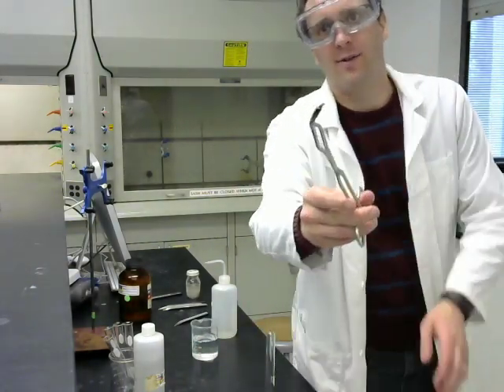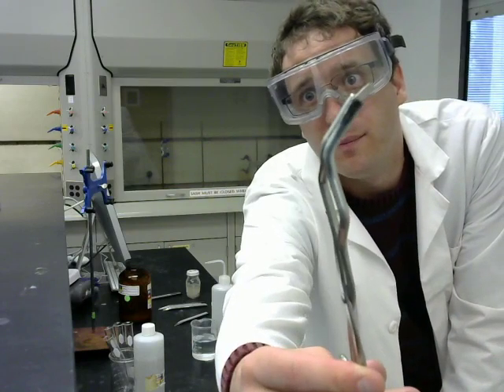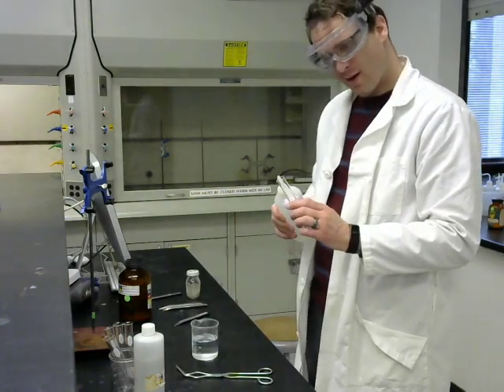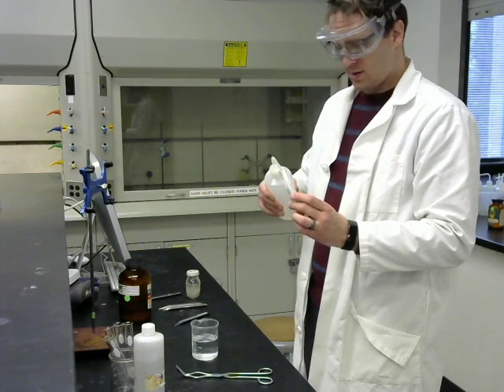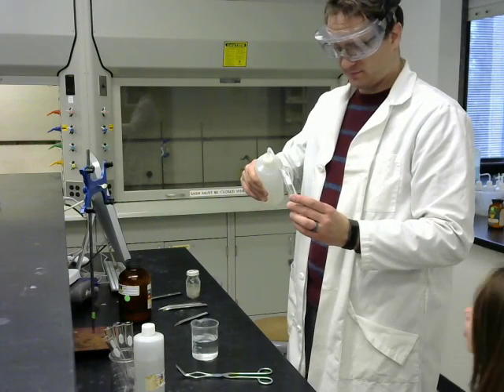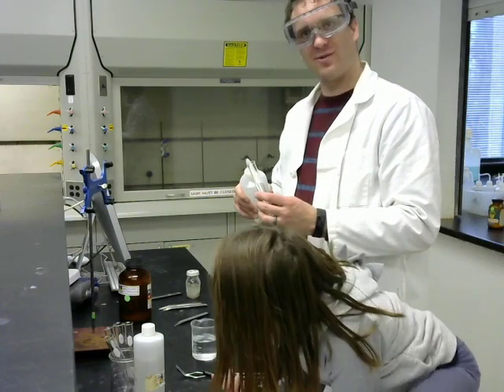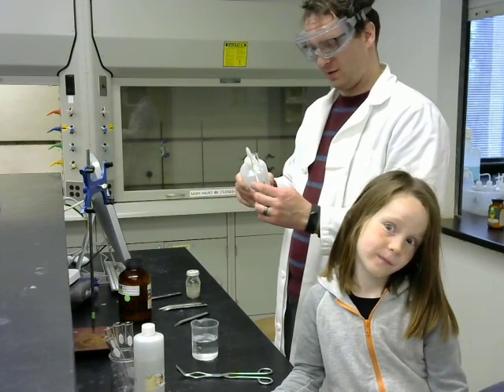And here I have a short strip of the magnesium metal ribbon. And we're going to do the same thing we've done, where we fill a test tube with water. Sorry, it's taking a bit. You're filling it with water again? Yeah. Are you trying one that might sink? Yeah, I'm going to hold it this time. I considered redoing that last experiment, but I thought I'd just kind of leave it. That's how science goes. You can learn from your mistakes.